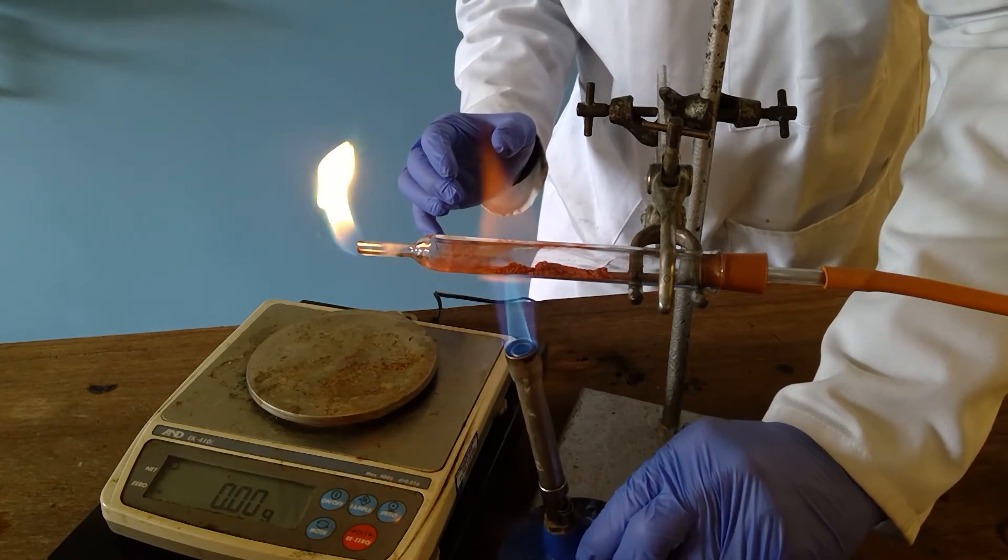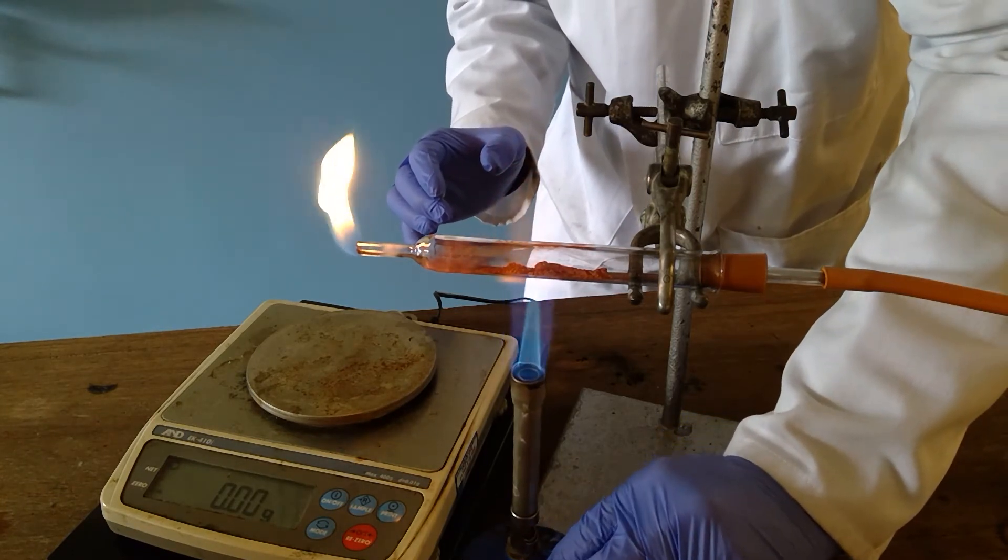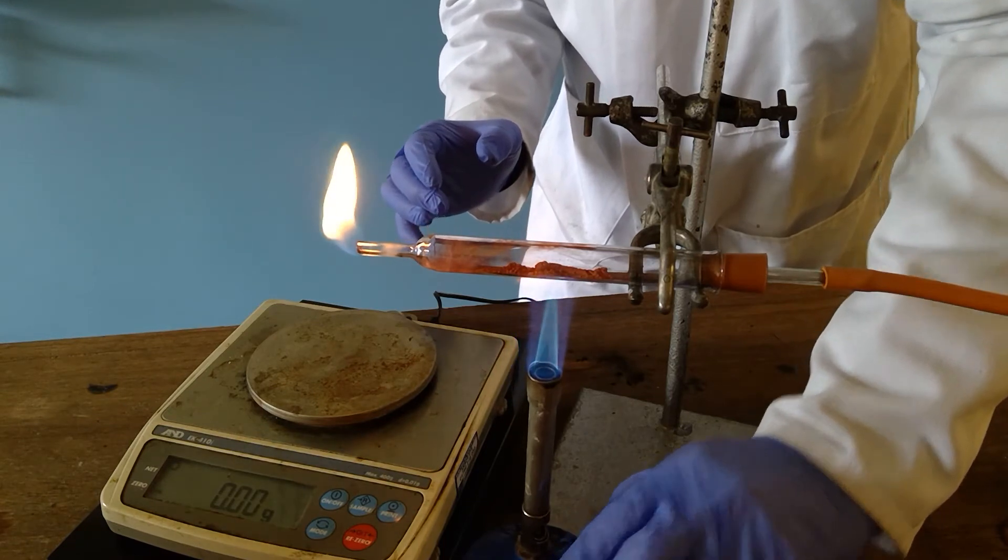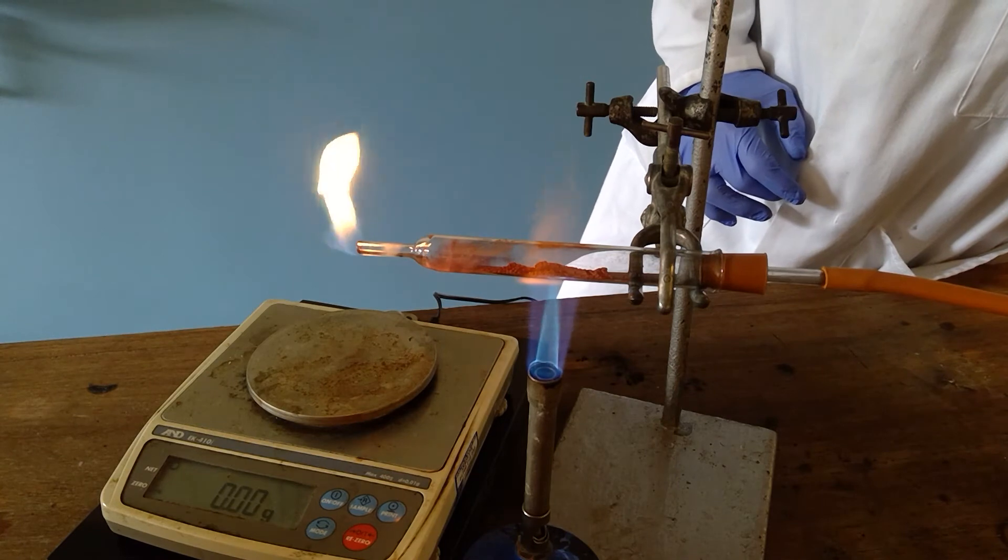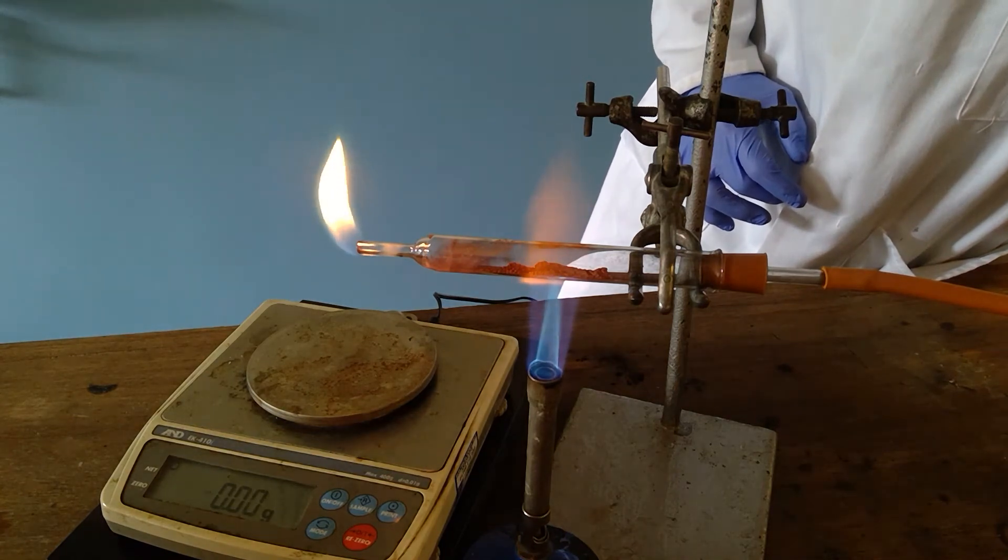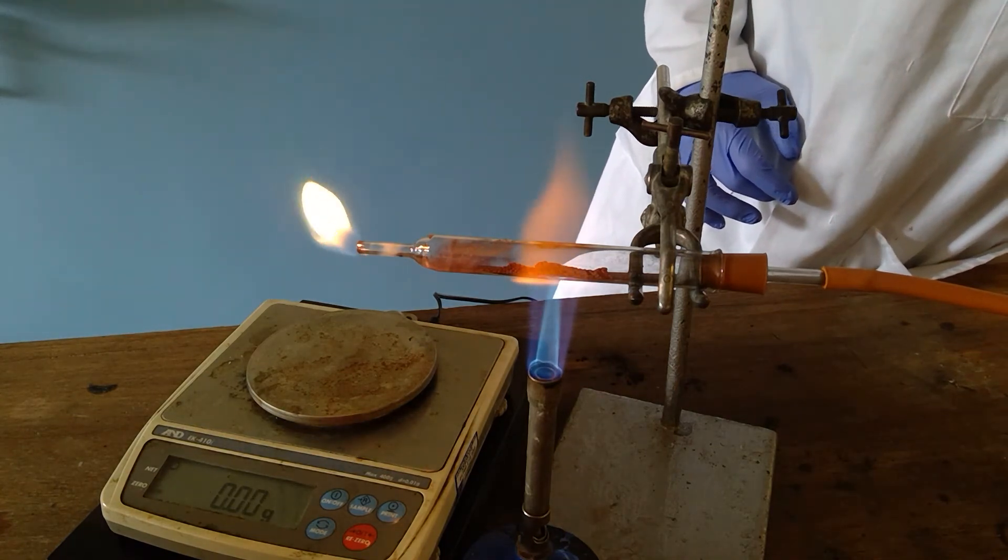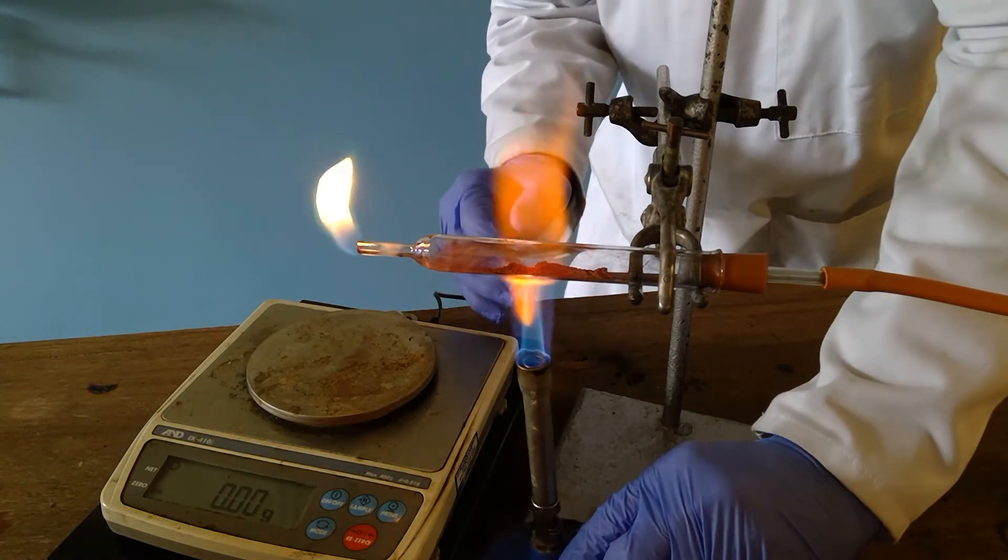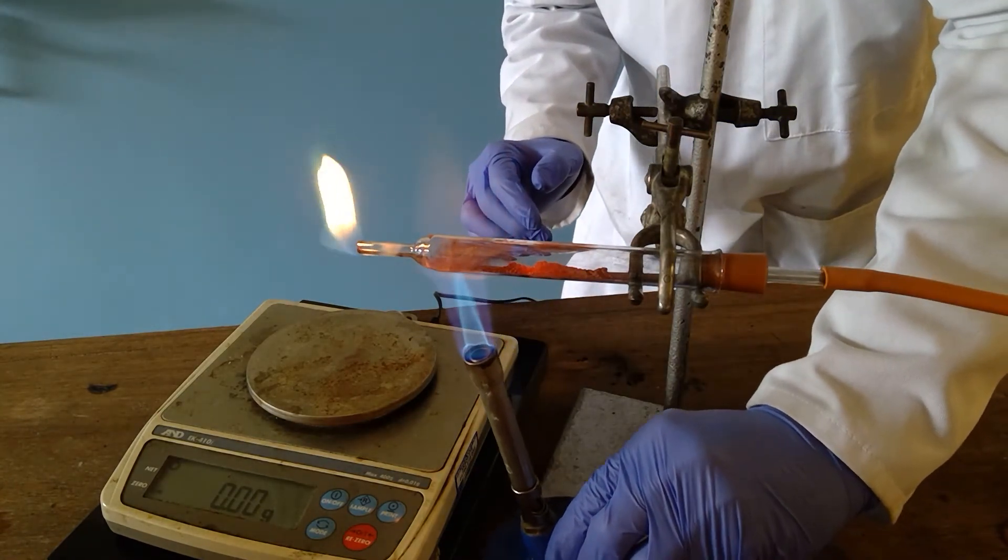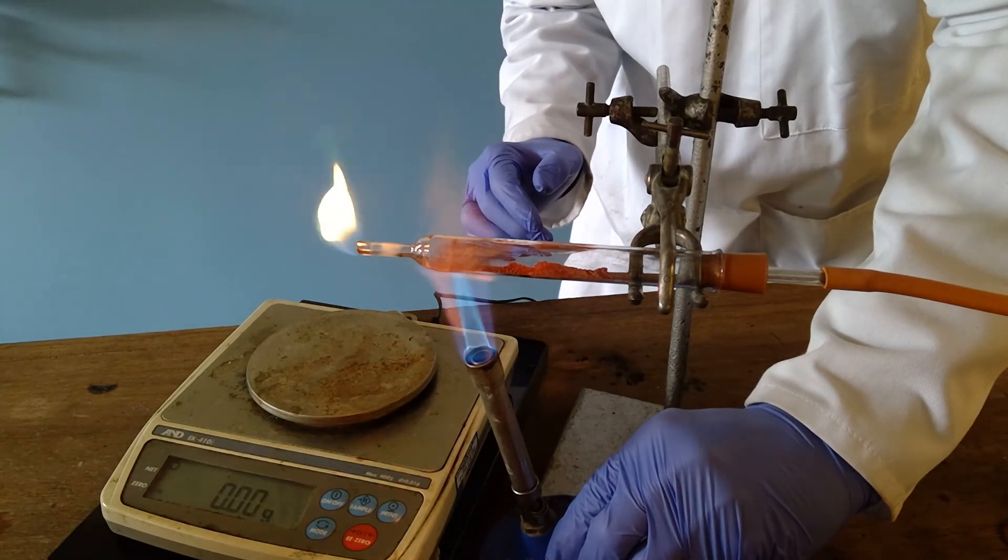Plenty of copper oxide has now converted into copper so we will just raise the heating level still further to see if we can get more and more of the copper oxide converted.